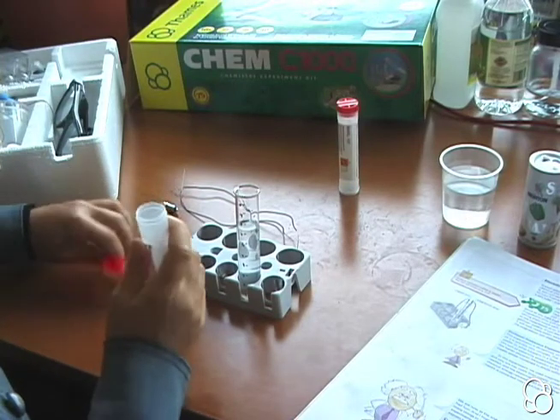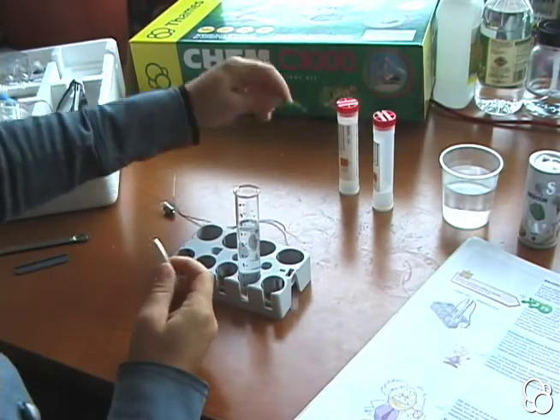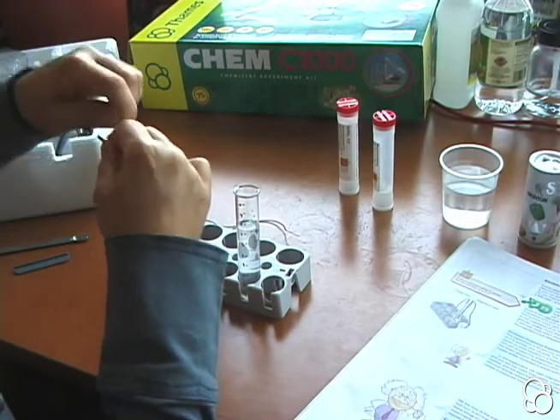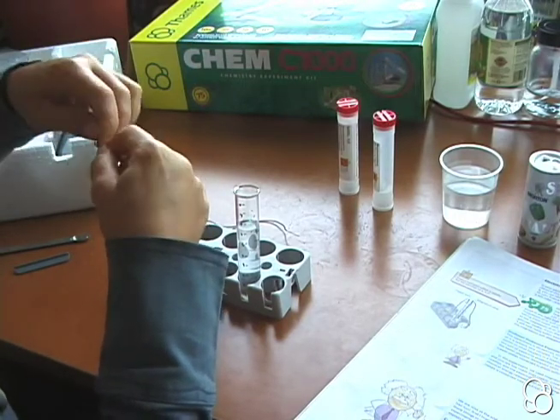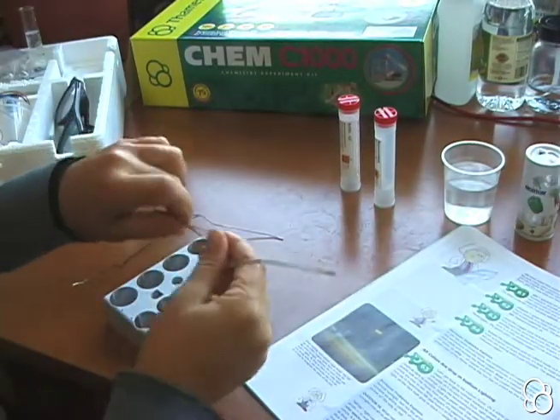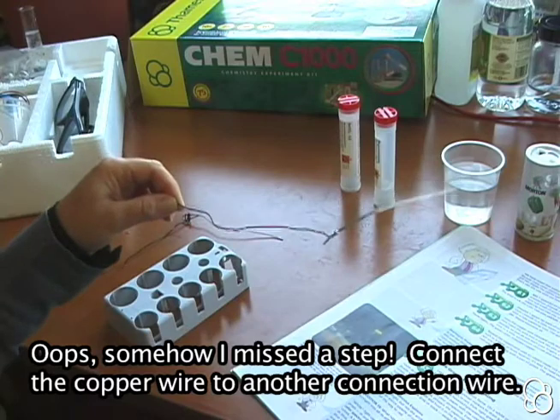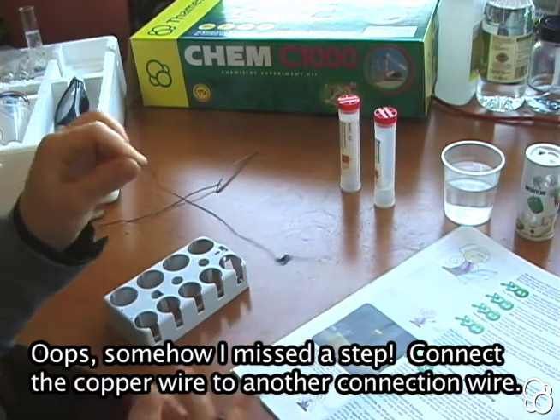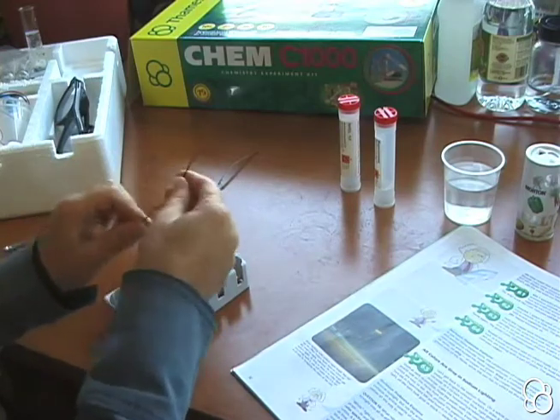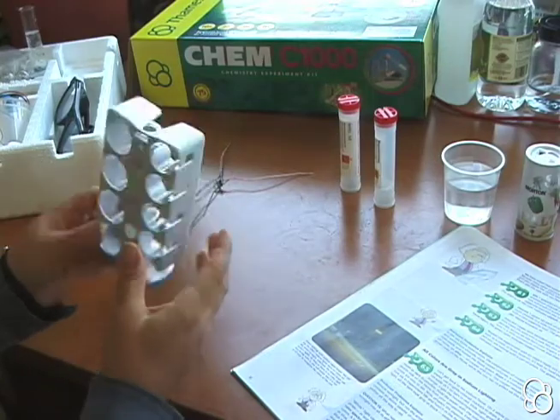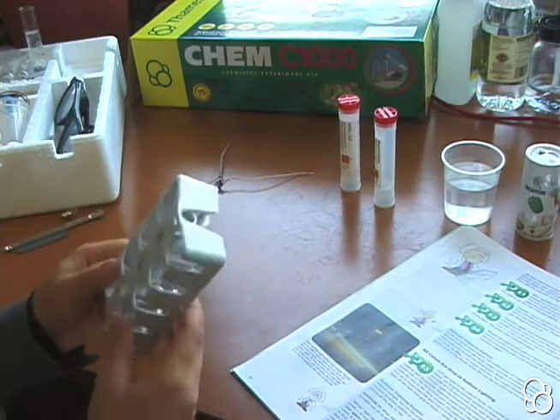You have two of them, but you only need one. You're going to wrap one of the wires, the ends of the wires, around one end of it. So now you have these two pieces: a magnesium strip connected to one wire and a copper wire connected to another wire. Now we have to stick these two blue wires into the test tube holder to make a socket for the light bulb.